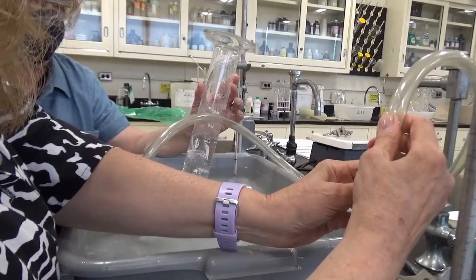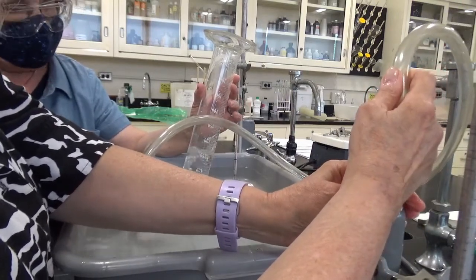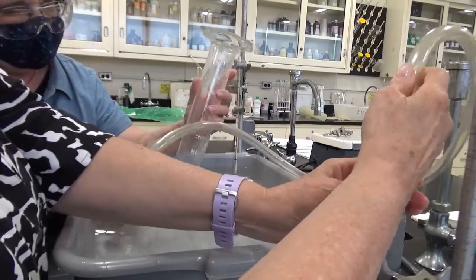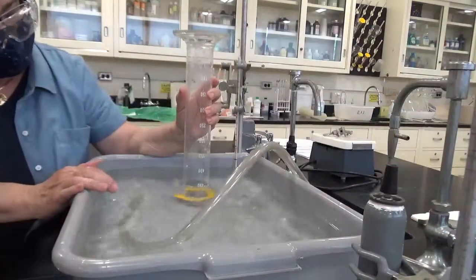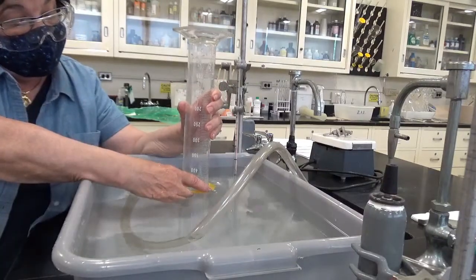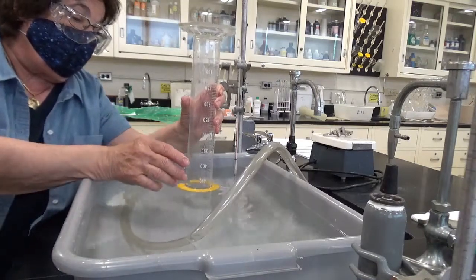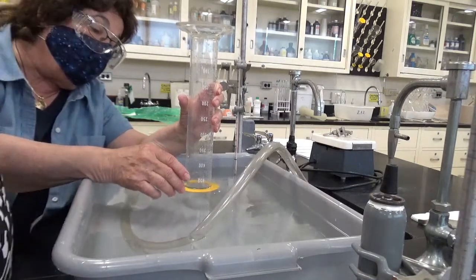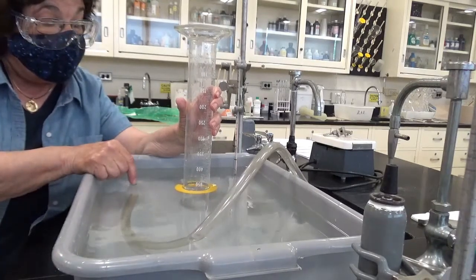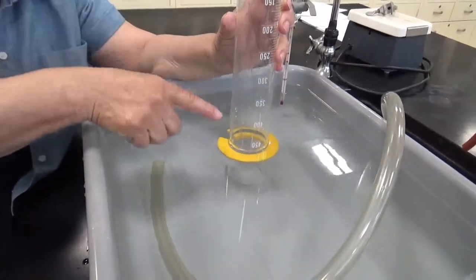So what we're going to try to do is to fill this, but not till the gas comes out the bottom. Getting close to, oh, I stopped. Good. All right, so now what we do is we have a cylinder with gas in it. I got to bring it up or down so that the level inside and the level outside are the same. So when I do that, I want the inner level and the outer level to be identical, and then we can measure the exact volume, or as good as we can.